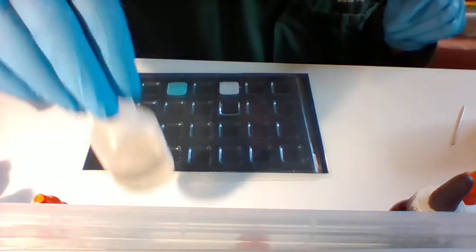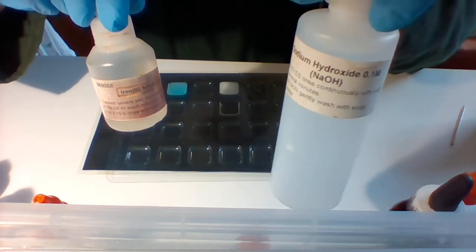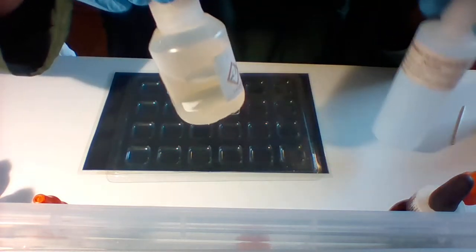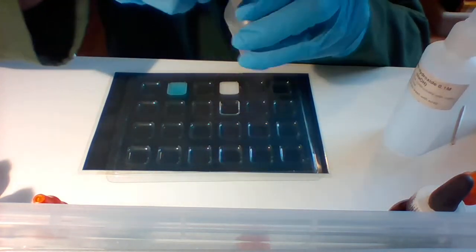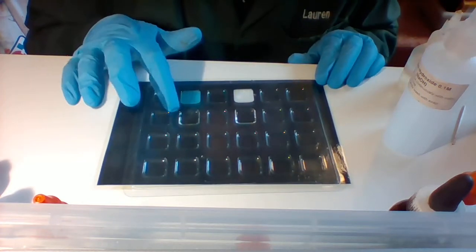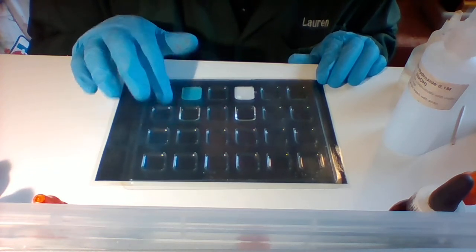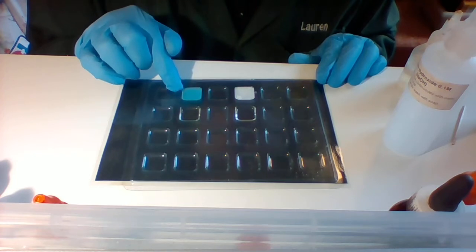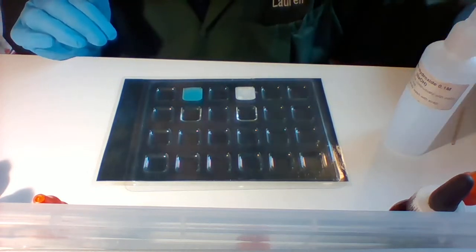All right, the next one we'll do iron nitrate and sodium hydroxide. So iron nitrate is clear, but it's kind of yellowy, and sodium hydroxide is clear and colorless. Okay, so put some iron nitrate in. You can see it's clear, so you can see the black cardboard straight through that. See, this one is not clear because you can't see the black through it. It can have color and be clear, or be, yeah, opaque.